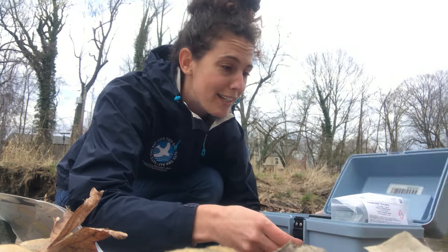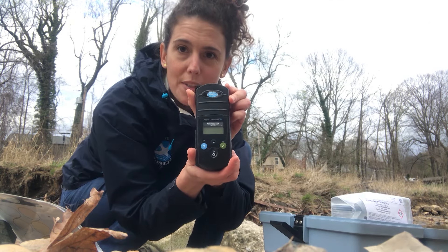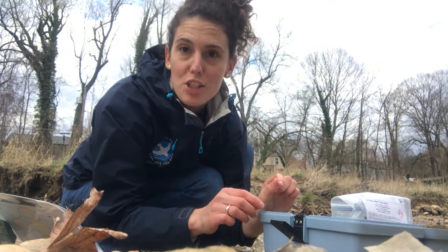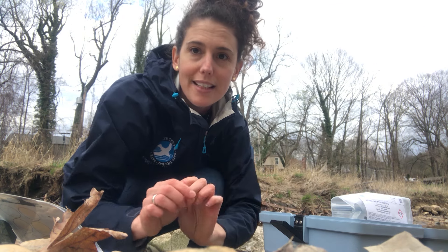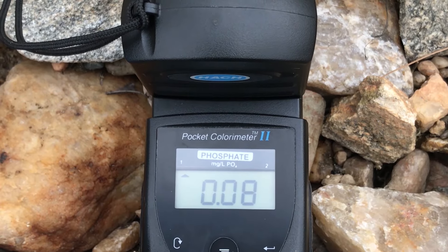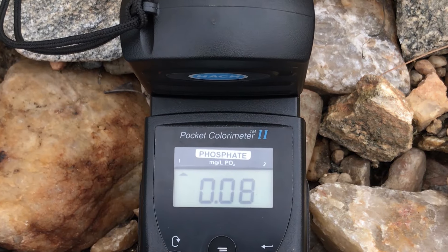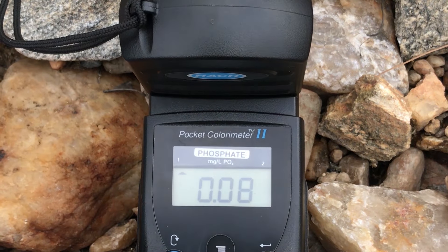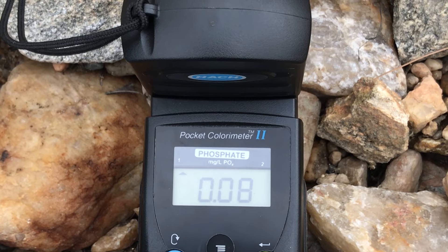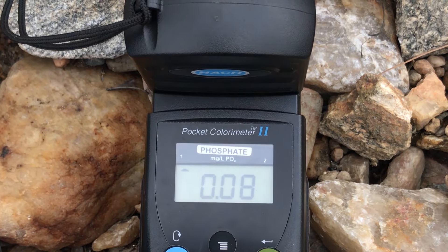Now I'm going to test the phosphate in the water, and to do this we use a colorimeter, which makes my job really easy. We want to see a phosphate level of less than 0.1, and today we've got a reading of 0.08, which is what we would consider to be in a healthy range — so this is good news.